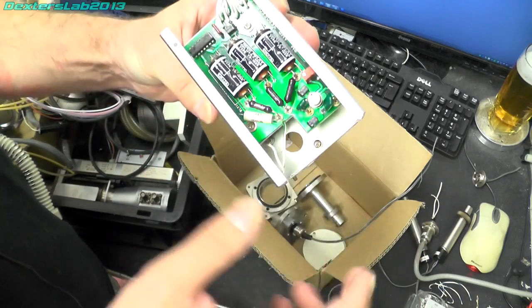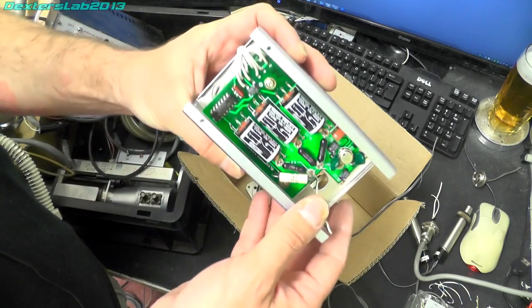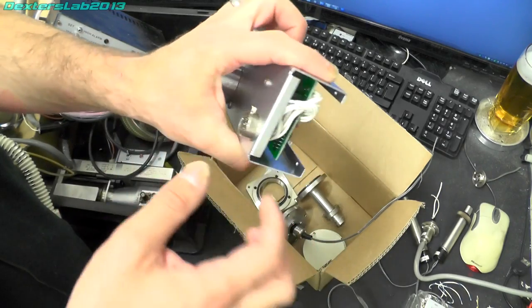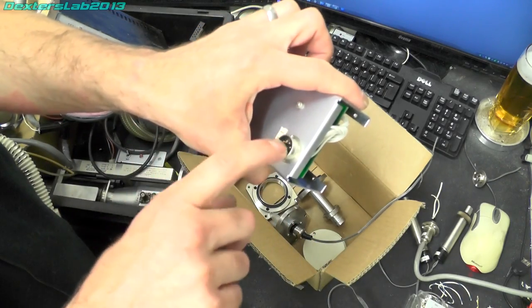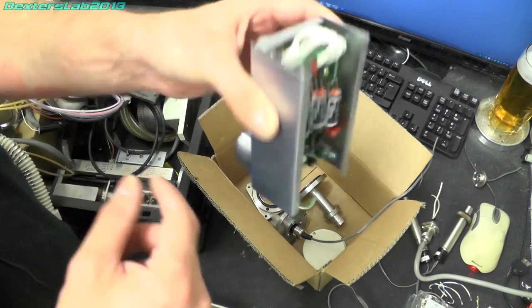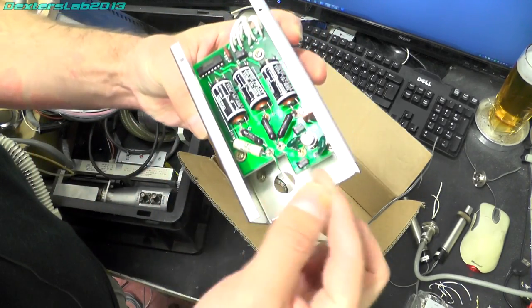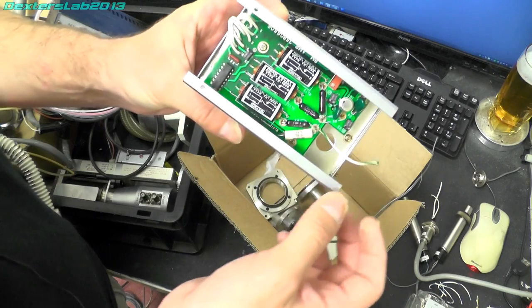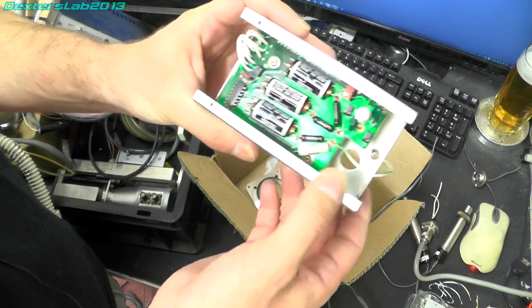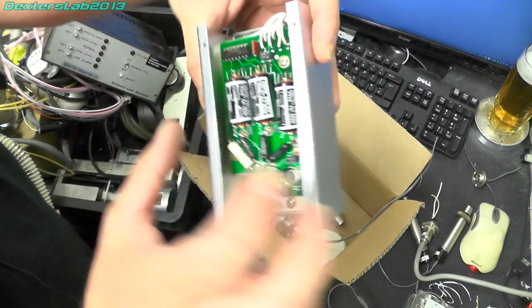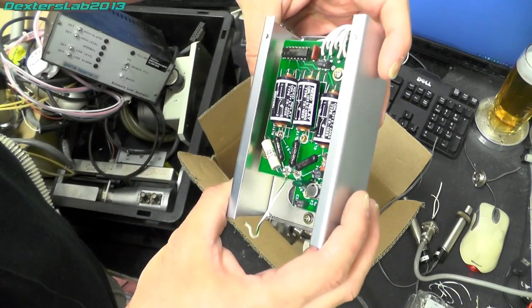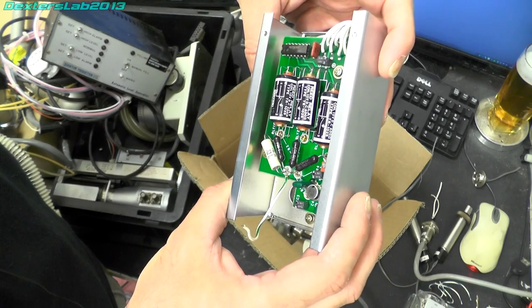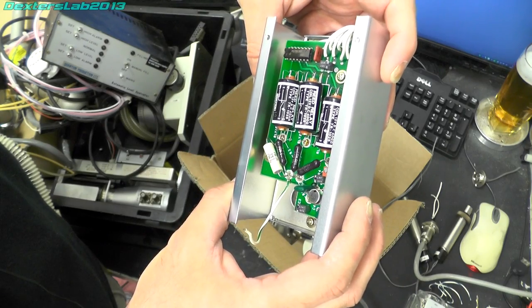I believe this is just an attenuation module, so we have the control from the system and this wire would have been the input. If we look here it's pretty simple, we've just got a 74 series chip there which is a HD7406P.